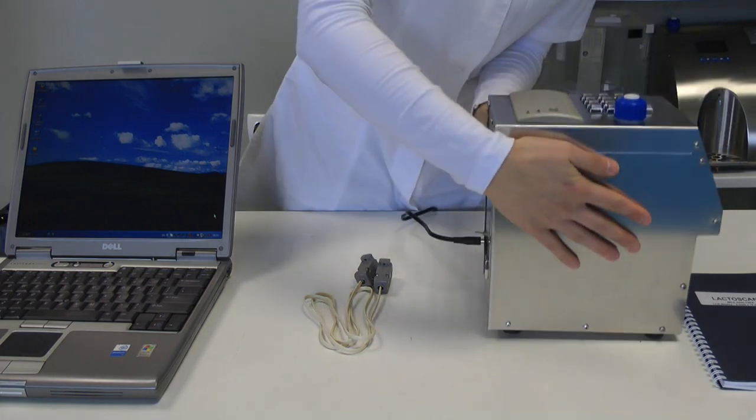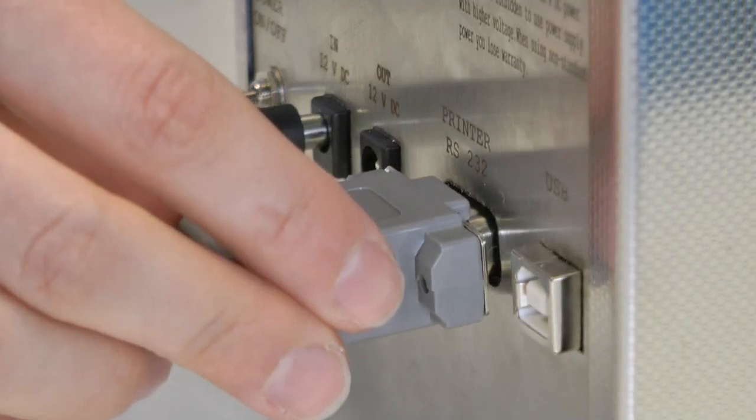Connect the analyzer to the PC using the serial port RS232.